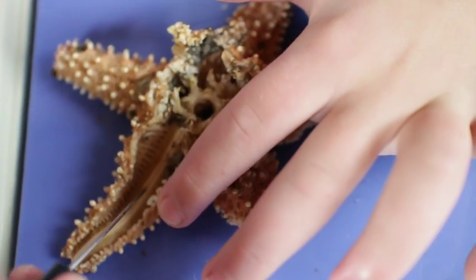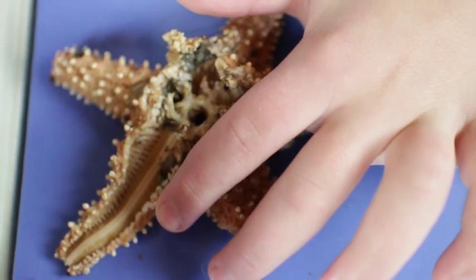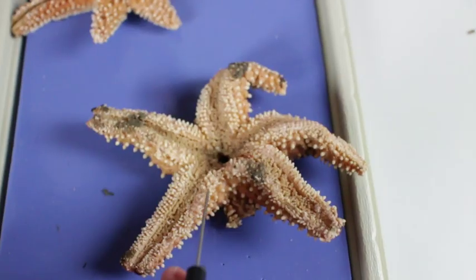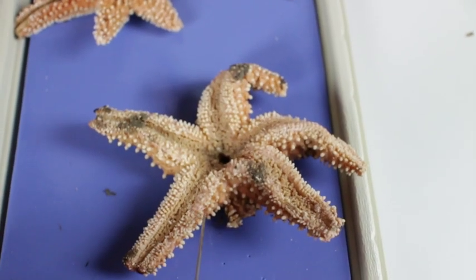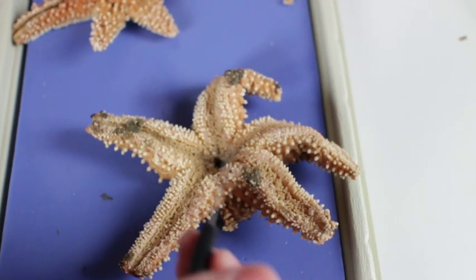Right here is the radial canal, and right on the bottom of the radial canal are the tube feet, which are the way the starfish moves around. They are kind of like little suction cups.